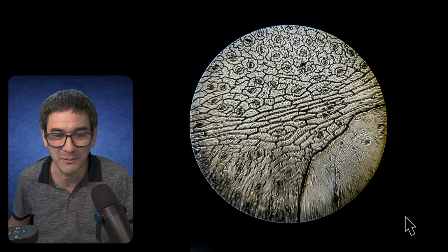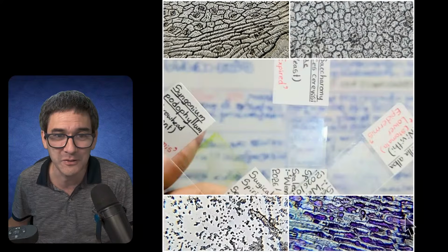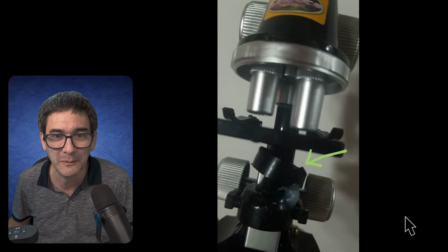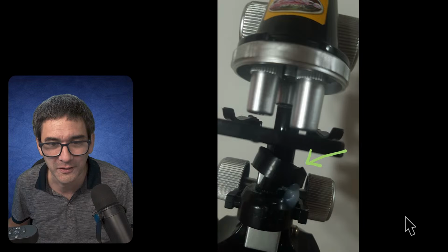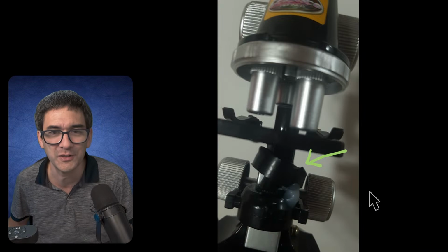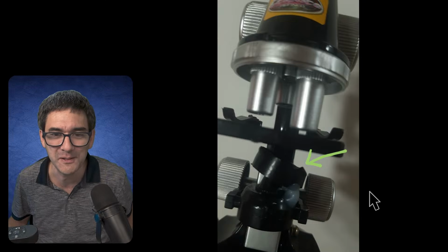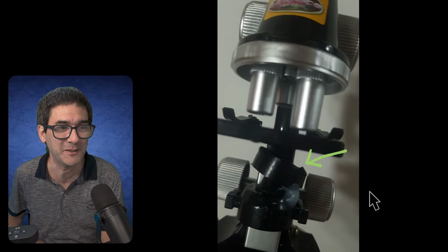I got a similar one also when I was a kid, seriously, a long time ago. It almost looks like a toy microscope. Over here, it seems to be some kind of lens element that was used to concentrate the light more, and then of course also the improved eyepiece. I just wanted to share this with you because I found that to be quite nice.